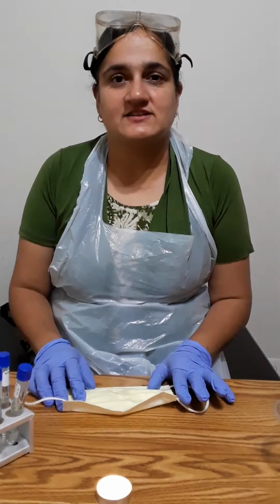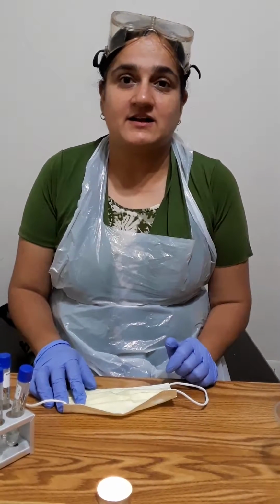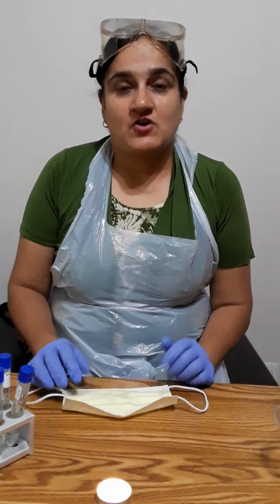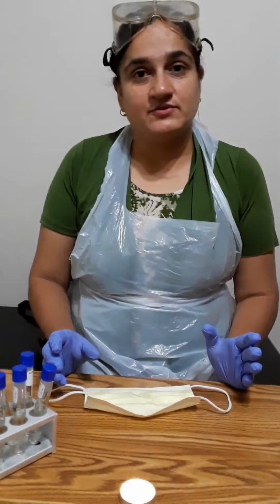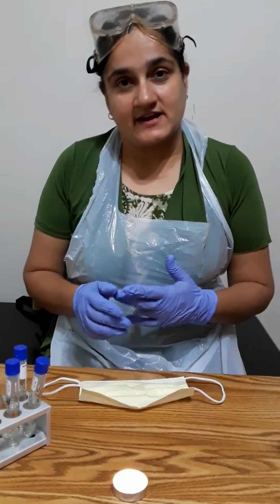This is week 6 of Bio 225 class, and this is part 2 of the lab experiment, environmental influences on microbial growth, the salt testing experiment and a pH experiment. In this part 2 I'm going to use the 6 nutrient broth tubes, and I'm going to label them 5, 7 and 9.